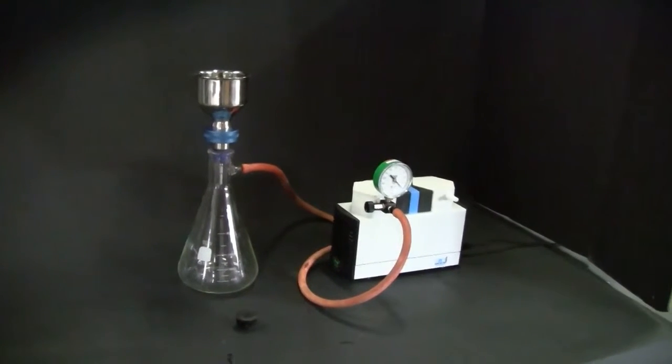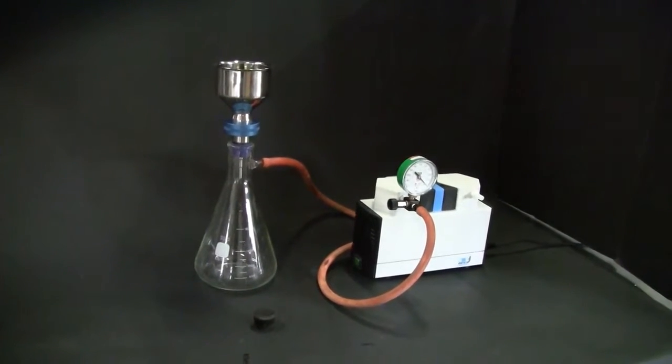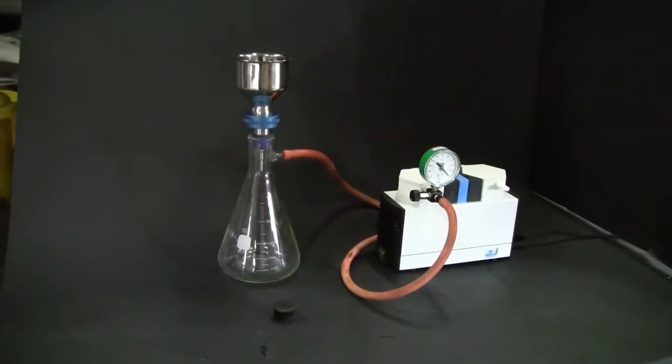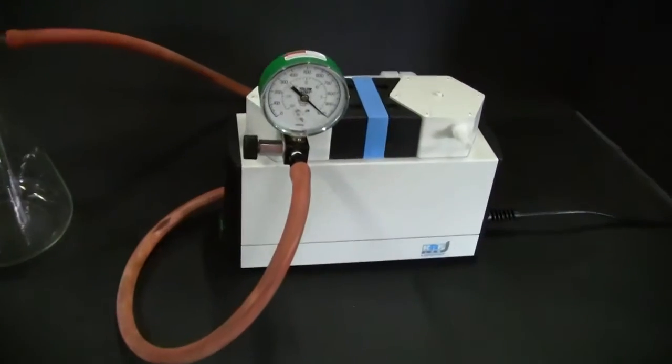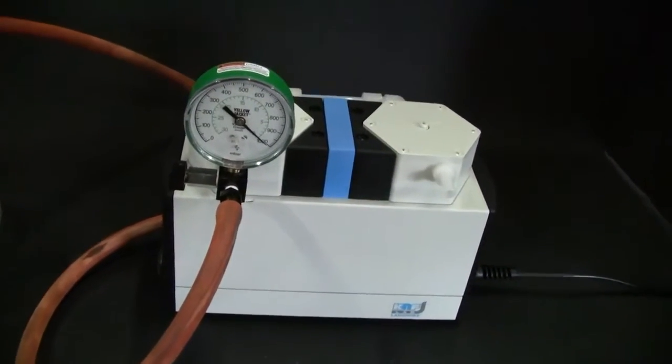Hi, this is Michael Nate Dow from Hi-Tech Trader. Once again, we're going to perform a quick experiment using a KNF UN820.3 vacuum pump.